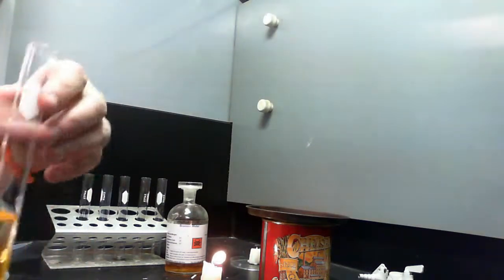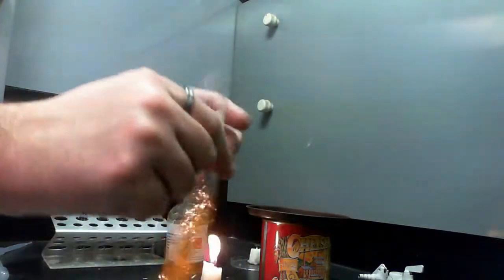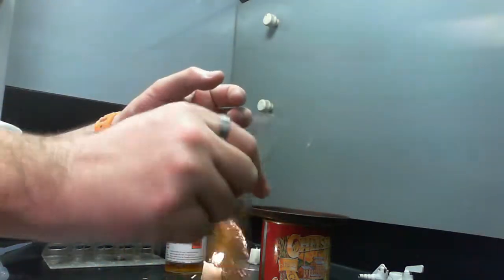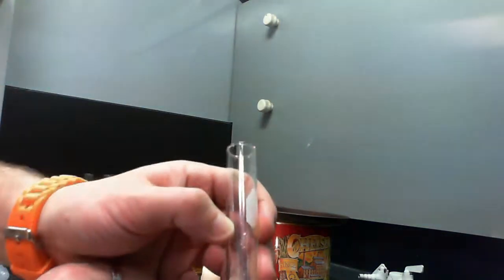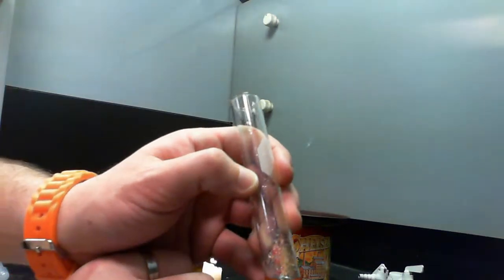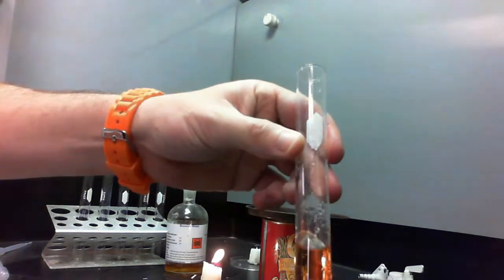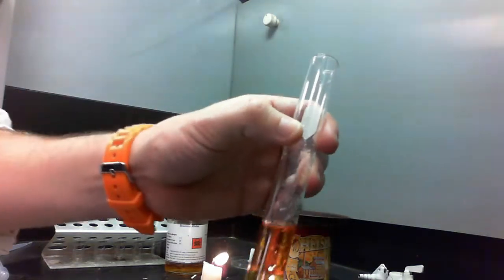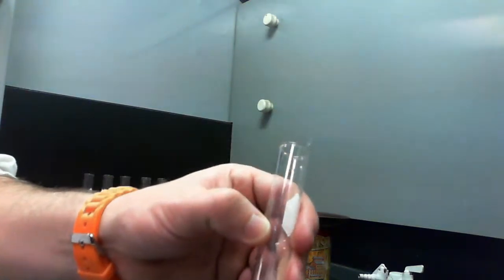You can see there's nothing much happening. Okay. If I give it a good shake and let the two layers mix, and make sure I expose it to light, then we do start seeing something happening. The first thing we're going to notice is the bromine is being drawn up into the higher layer here, and you can see that by the colour difference. Now if I expose that to natural light, so the ultraviolet part of natural light, for about 10 minutes, this colour will start to fade.